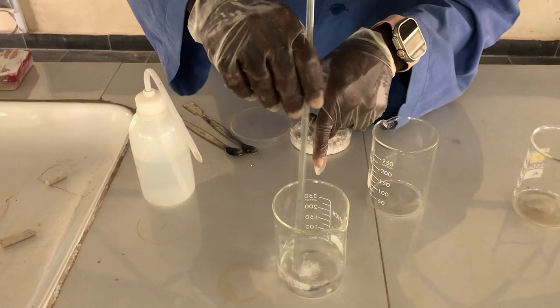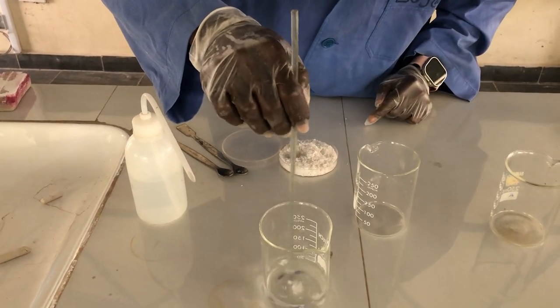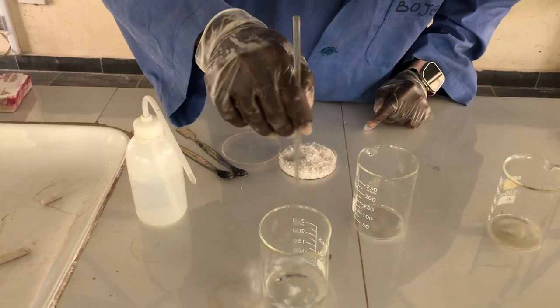Now let's observe what is happening. The solute is dissolving.